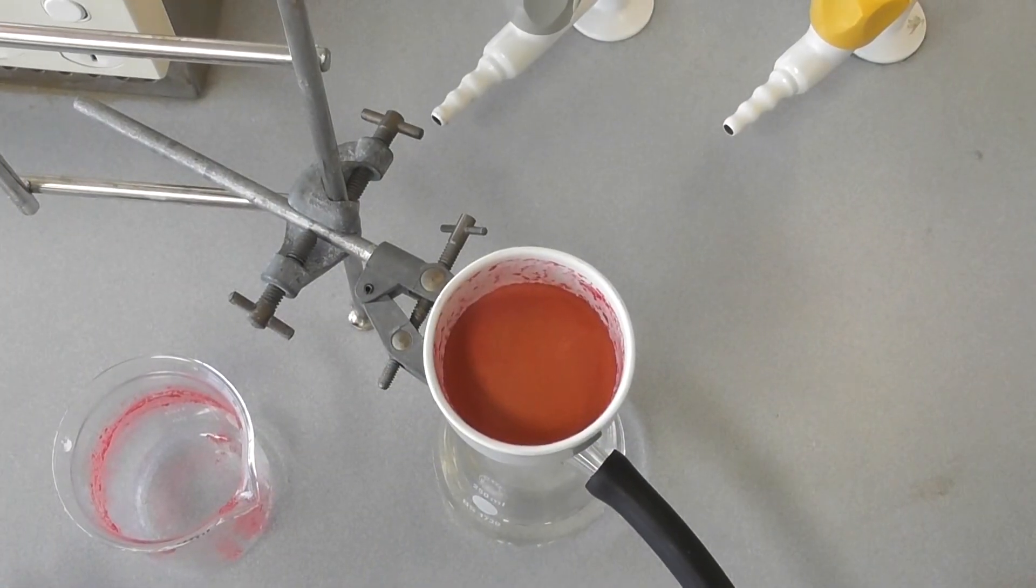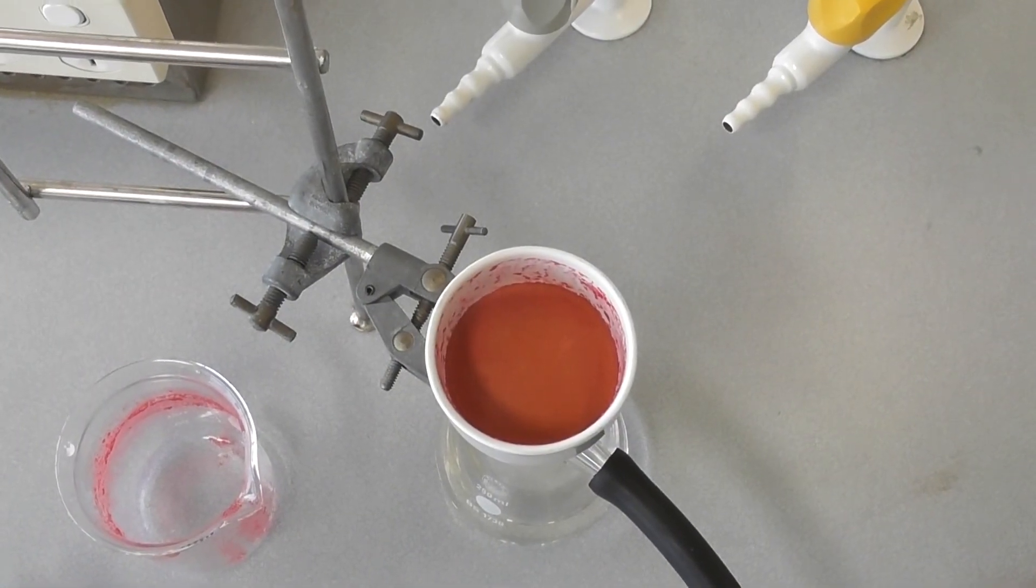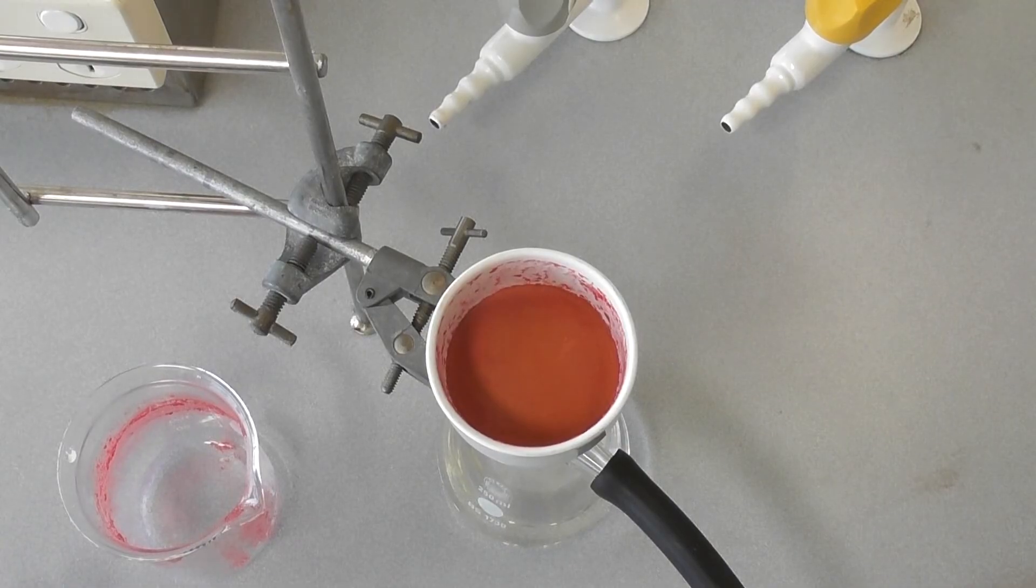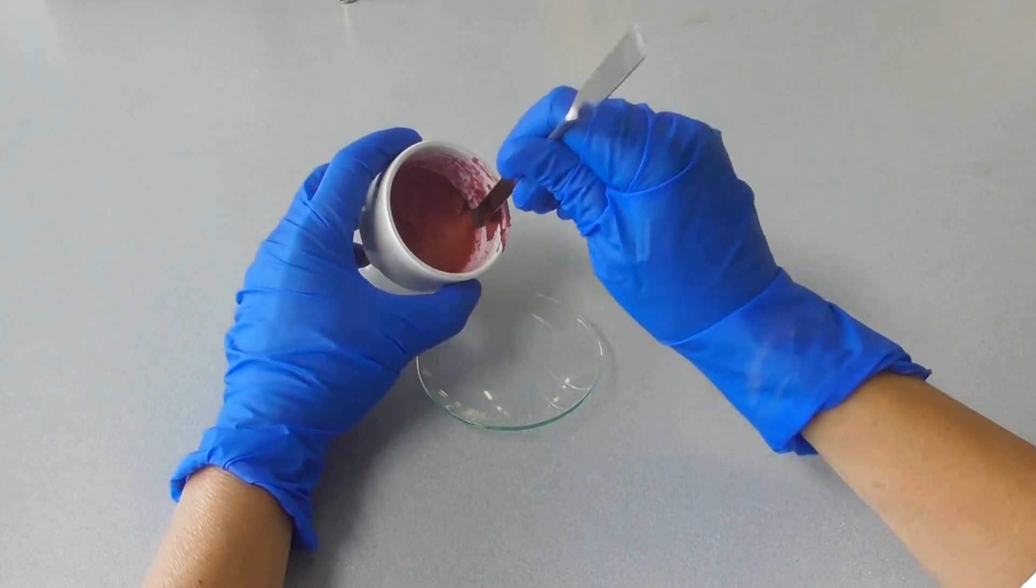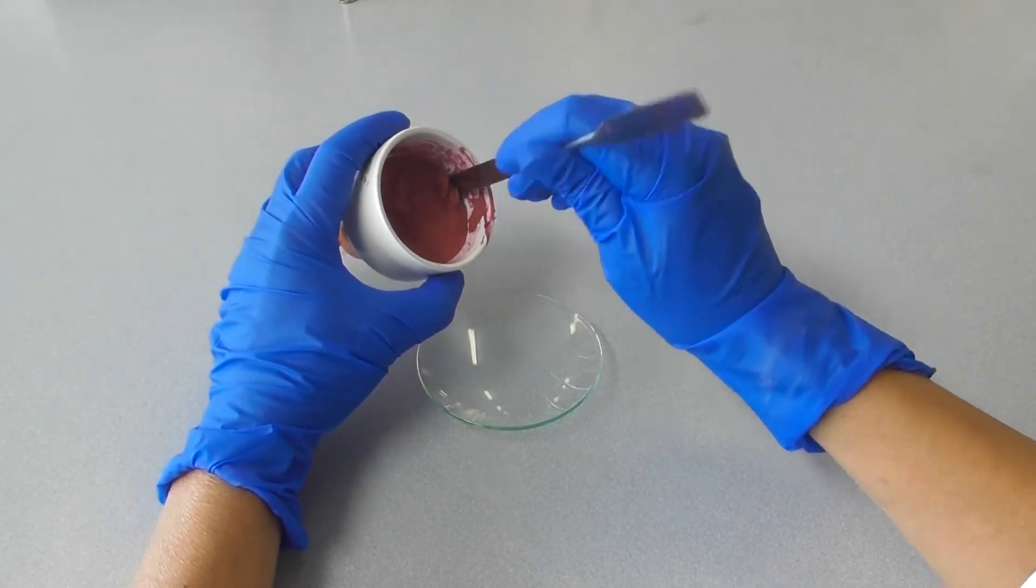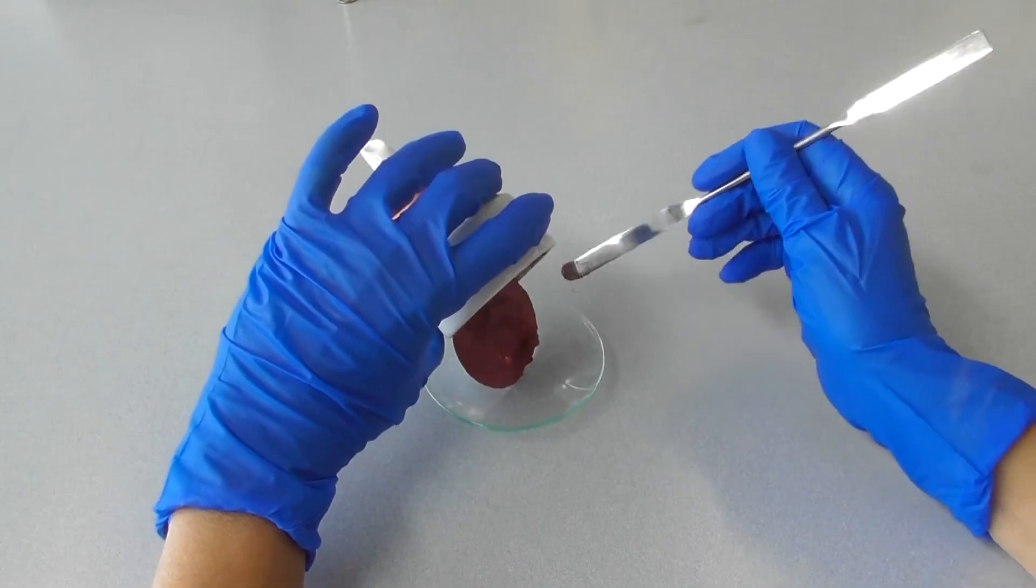Now we have a finished product ready for collection. This can either be removed on the filter paper or if left to dry can be scraped off the filter paper.